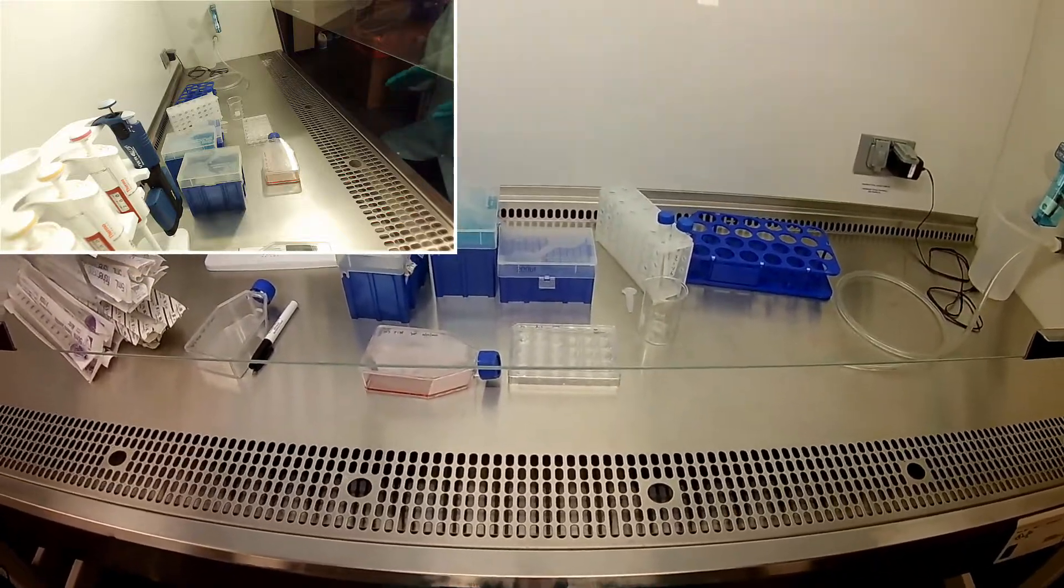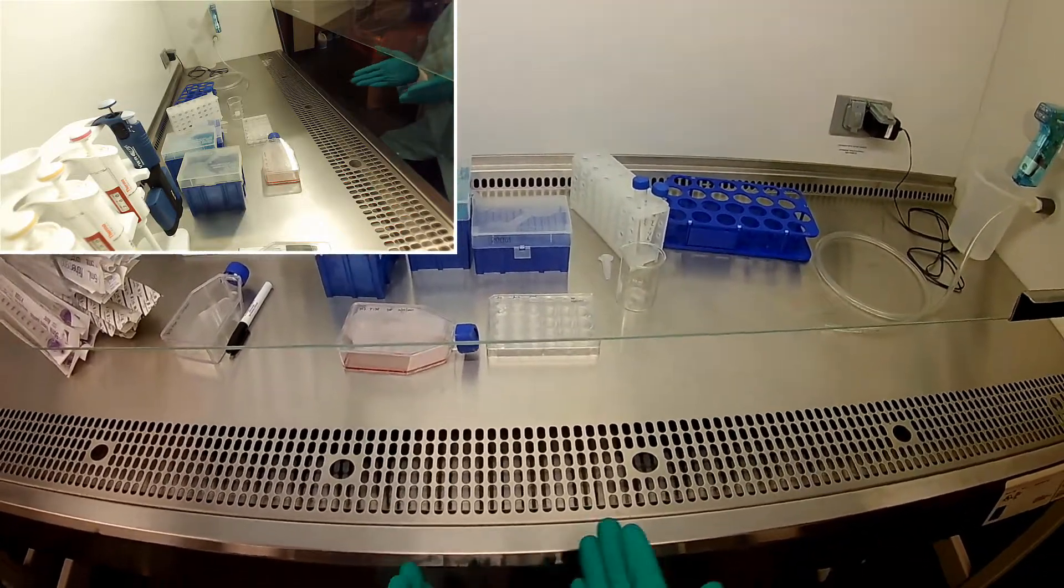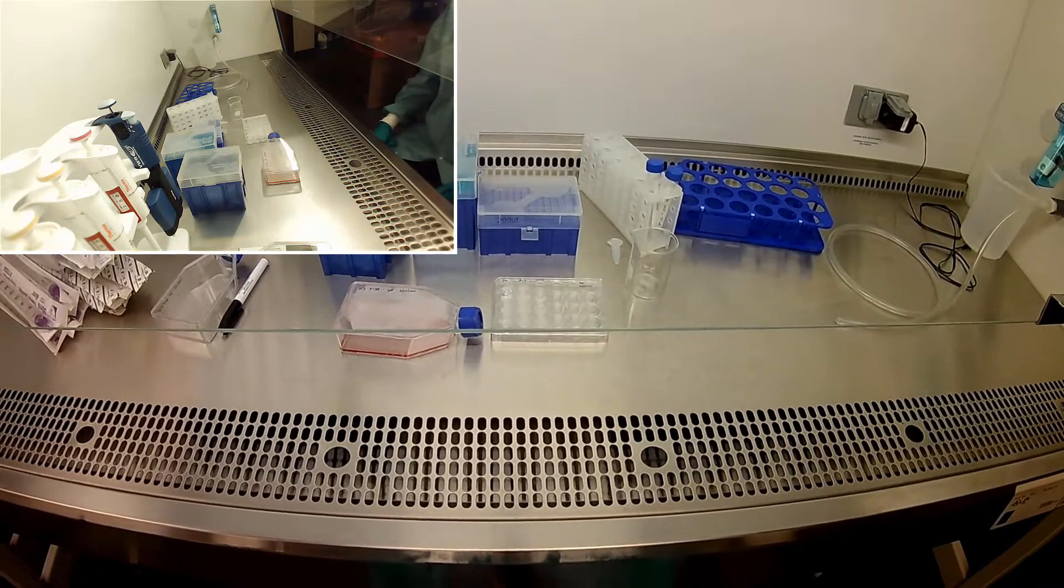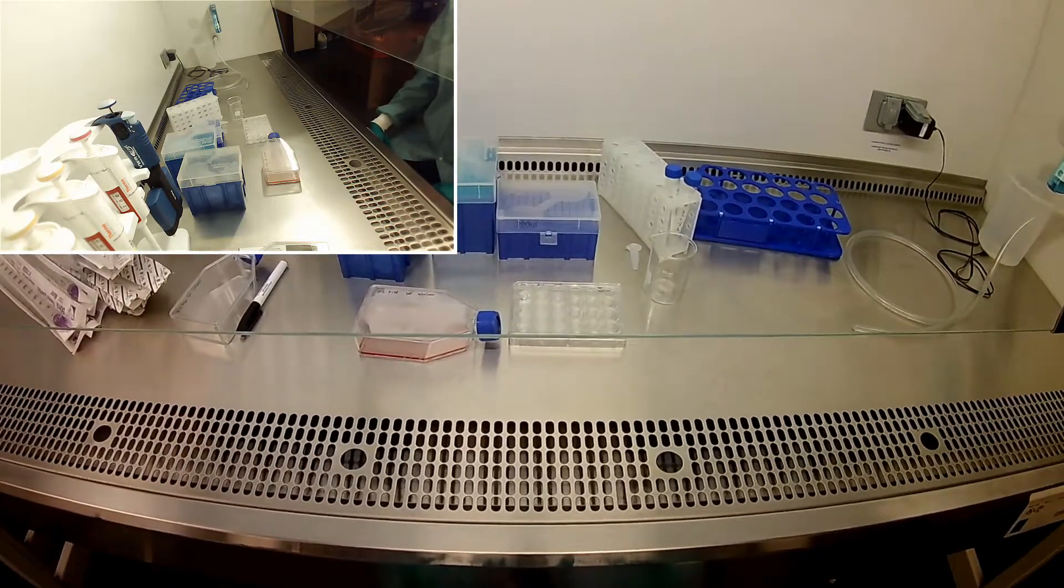Okay, everybody, here we are. We're going to seed our cells on top of the hydrogels we made the other day and see which ones promote adhesion a little better.